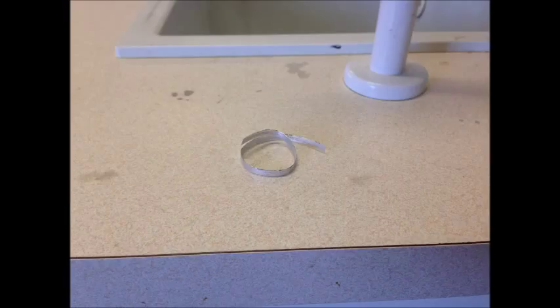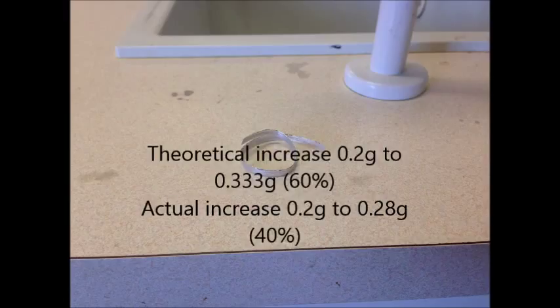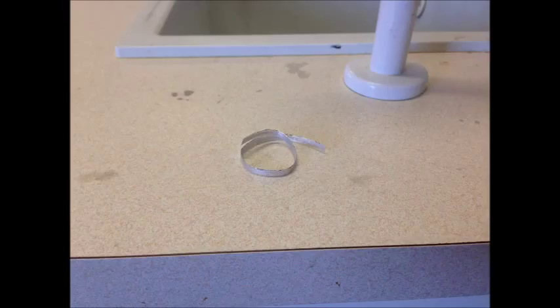The increase was less than the theoretical increase, which would have been from 0.2 grams to 0.333 grams, done in the mole calculation. Many factors come into play when doing this, as in the actual physical practical, some of the dense white smoke could have escaped from the crucible when burning. We could have had an issue with incorrect weighing, or maybe the mass of magnesium oxide will be too low if the magnesium metal does not combust, meaning we didn't burn all the magnesium in the crucible.